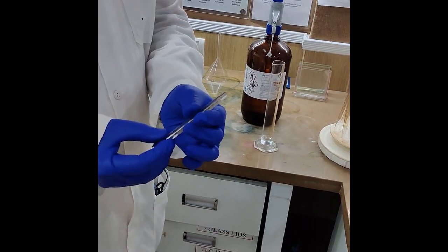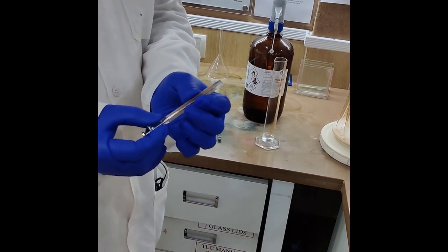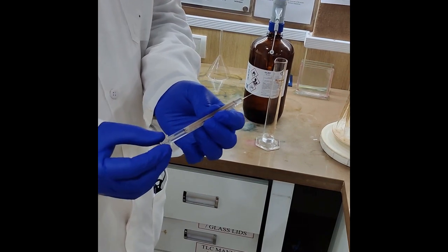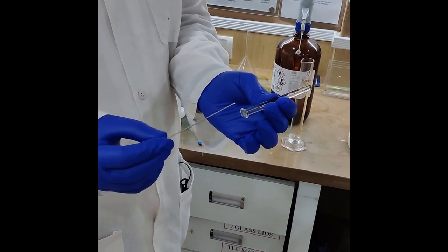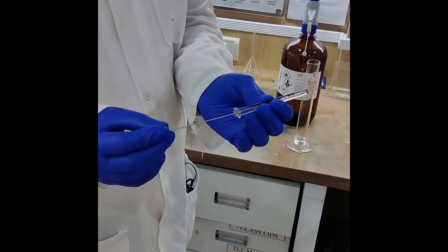As you know, the syringe has the following parts: the main body, which is made of glass, and the piston, which is actually pushing the solvent when the application is going on.